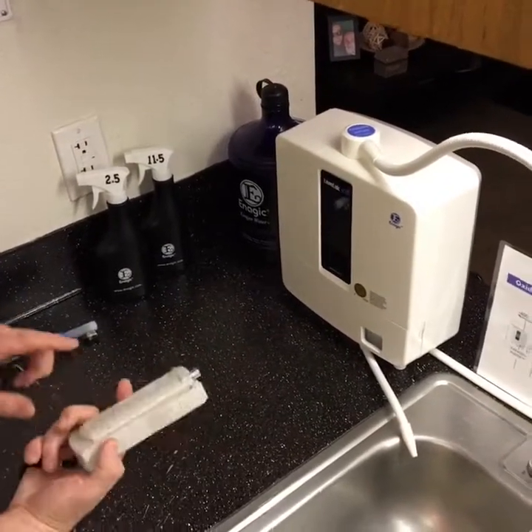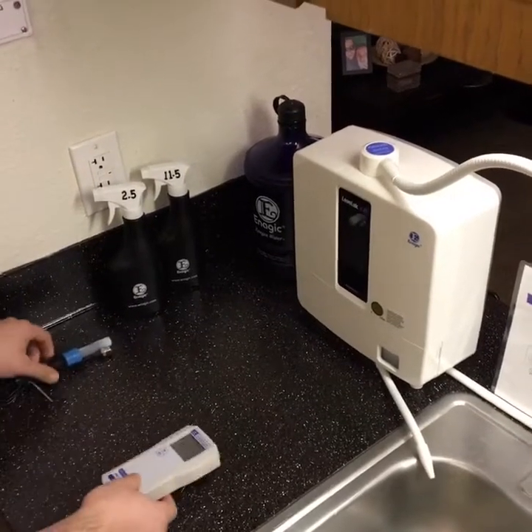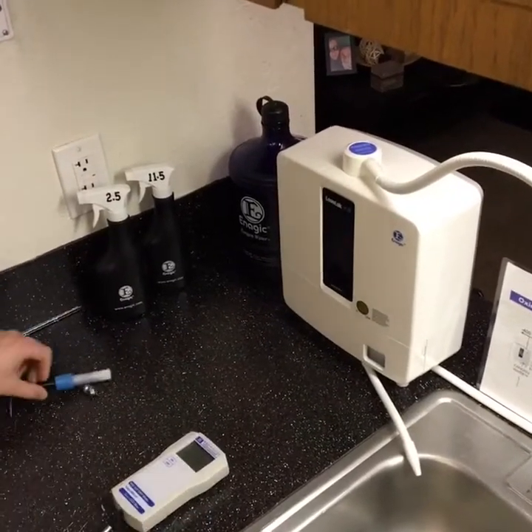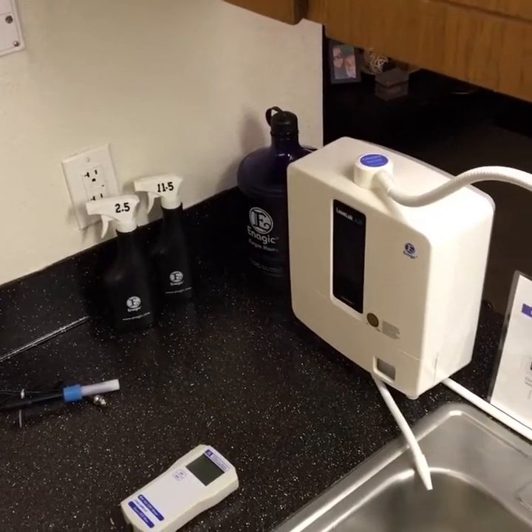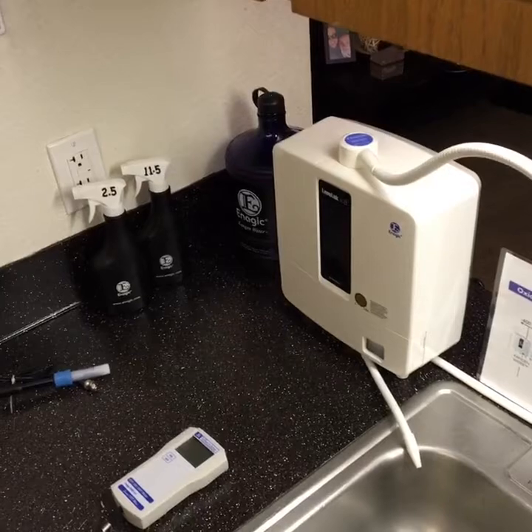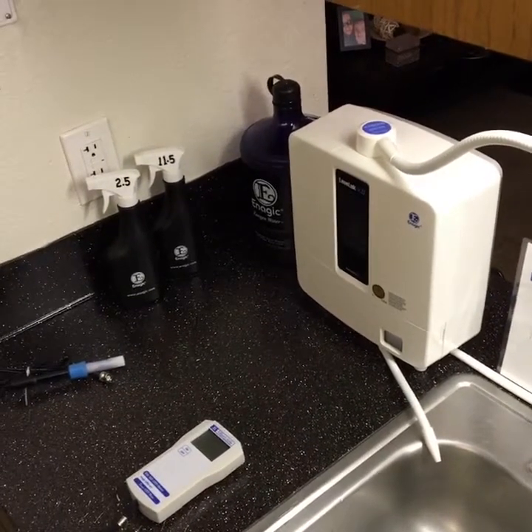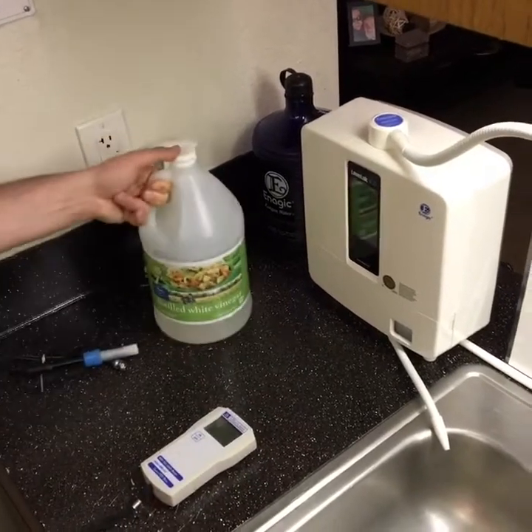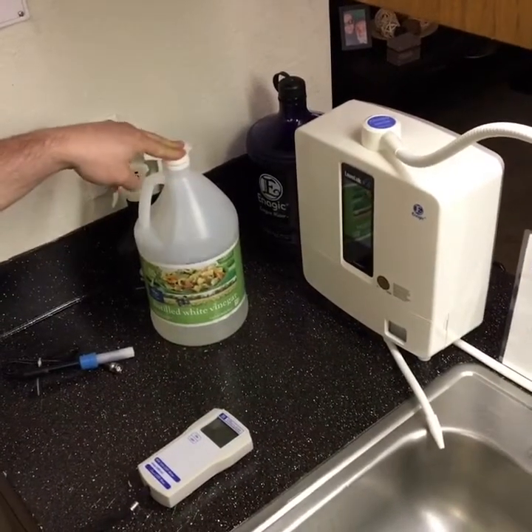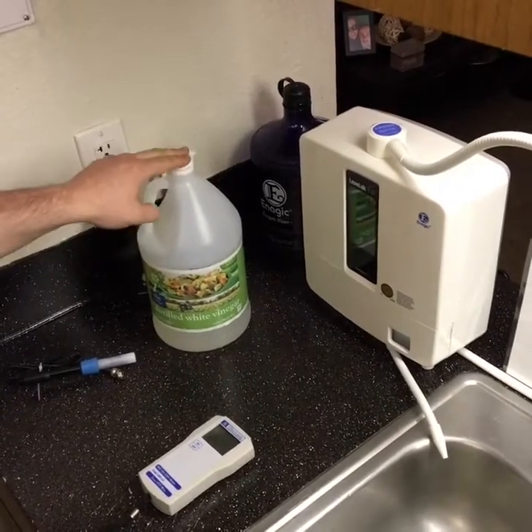You put the battery in and you're done — you can even get an adapter with it. I've talked to the manufacturers of this, and they said if you're doing negative ORP readings for Kangen water or negative water to read the antioxidant levels, you want to use distilled white vinegar — not white wine vinegar, distilled white vinegar.